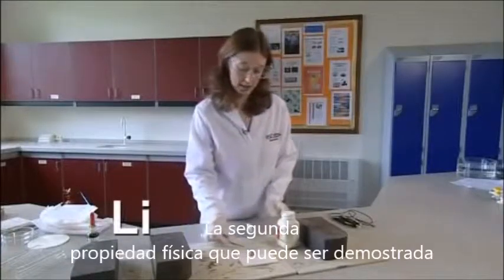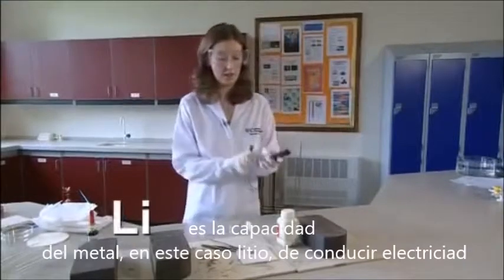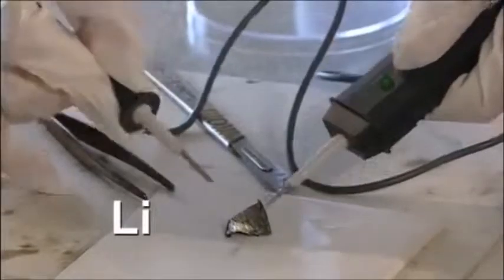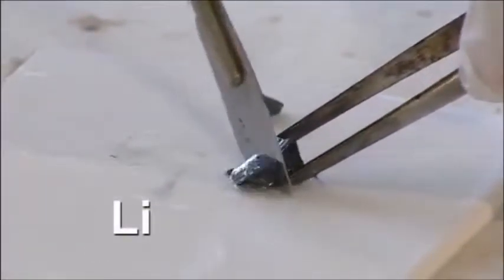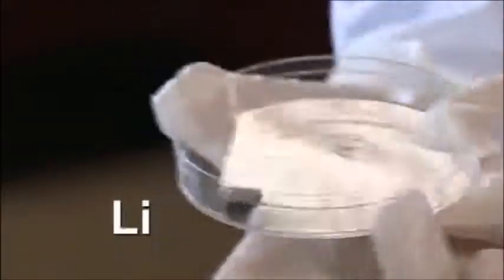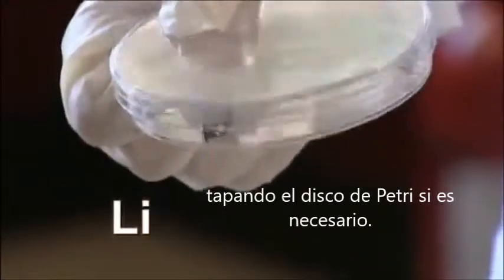A second physical property that can be demonstrated is the ability of the metal, in this case lithium, to conduct electricity. I'm going to cut a small piece of lithium. There we go. Pick up the piece of lithium and drop it onto the Petri dish. Pass it round the class so that the audience can get an impression of how light in weight it is. Warn students not to touch the metal, taping the lid onto the Petri dish if necessary.